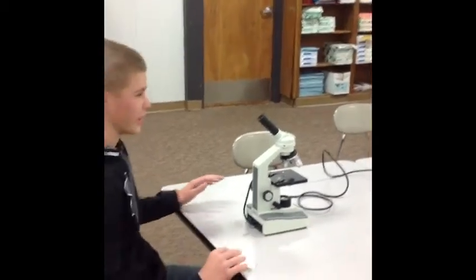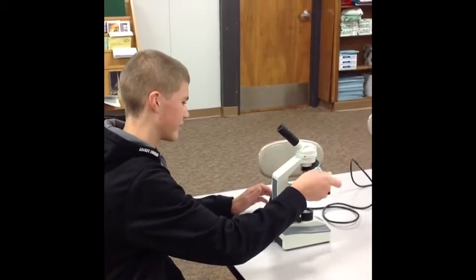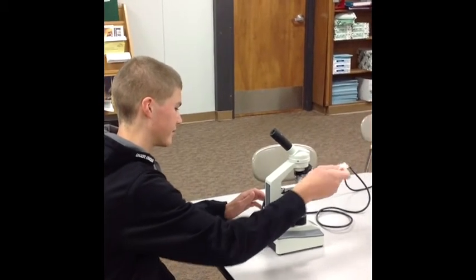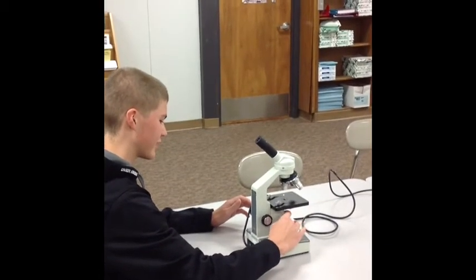Before you start, always make sure that you clean off the lenses just like this. And you always want to make sure the light source is clean too.